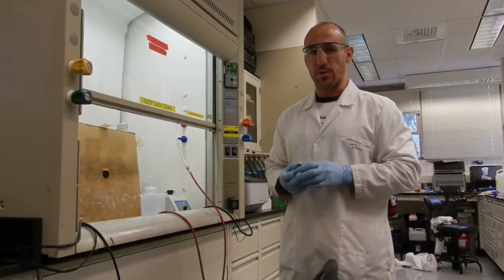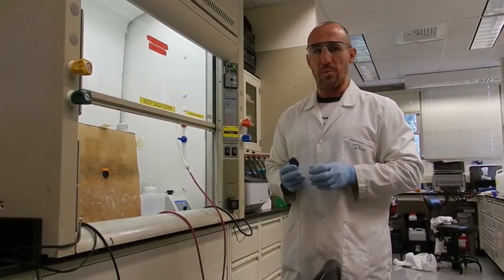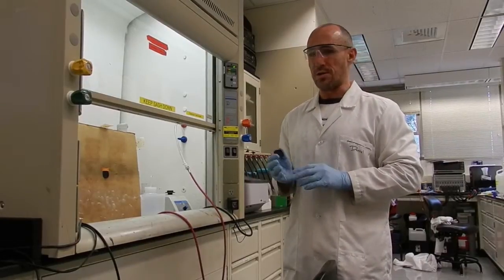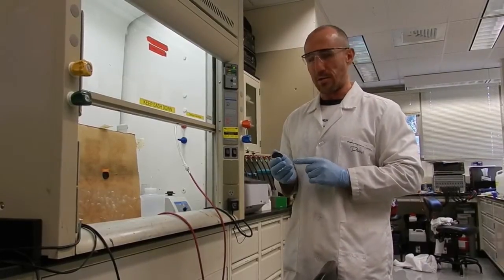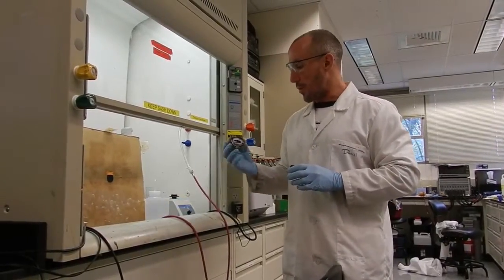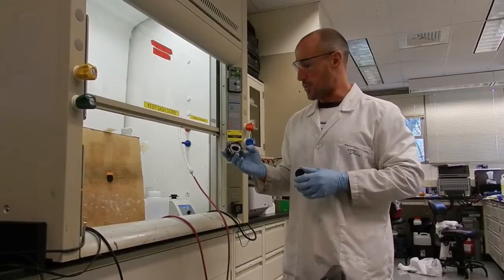Okay, so today I'm going to show you how to put a PVA separator using a spray method onto the standard platinum cathode on stainless steel that we use in our two centimeter cubic microbial fuel cells.